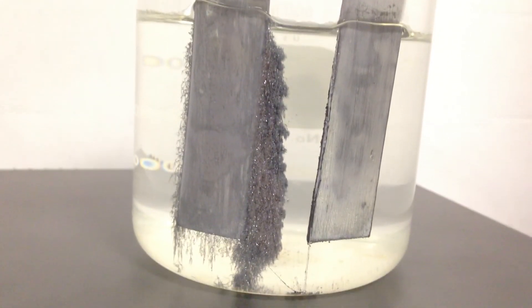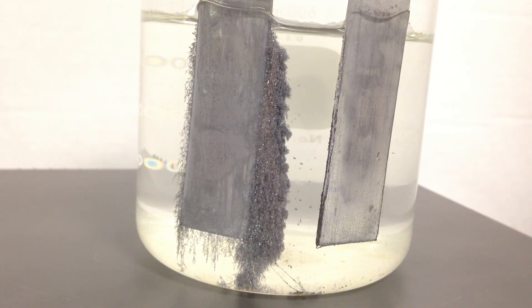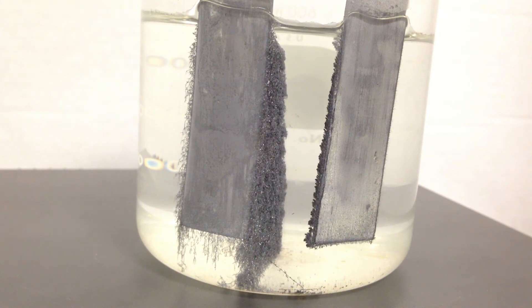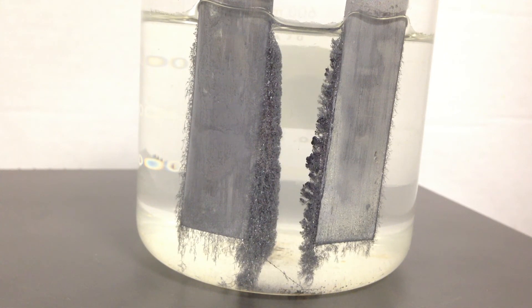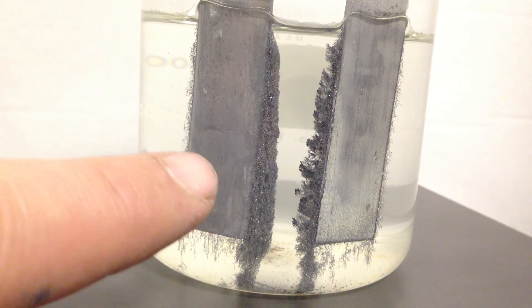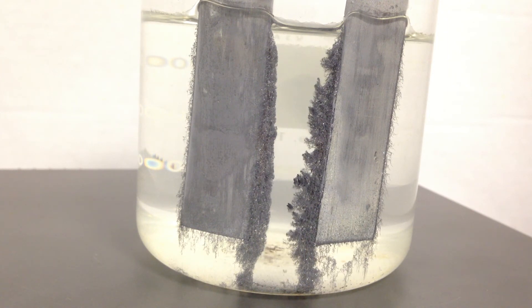By switching the leads, I'm turning the right electrode into the new cathode. Turning the current back on, we can see that the cathode — now the right electrode — is getting bigger because reduction occurs at the cathode. The left electrode, now the anode, is forcing electrons back, driving oxidation: solid lead is becoming lead²⁺ ions, so that electrode is getting smaller as the right one grows.